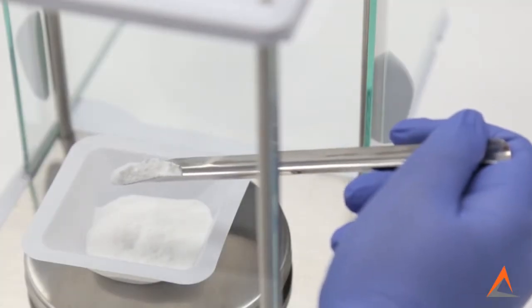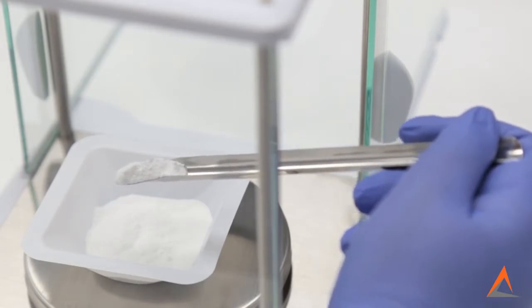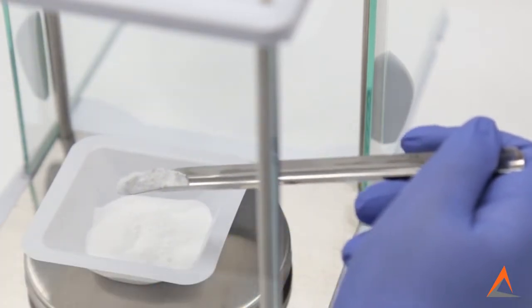It is very difficult to only drop a small amount of powder into your weigh boat when your hand is holding the far end of the spatula like I'm doing here.